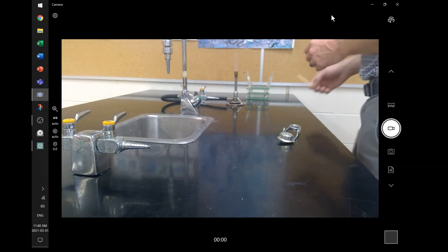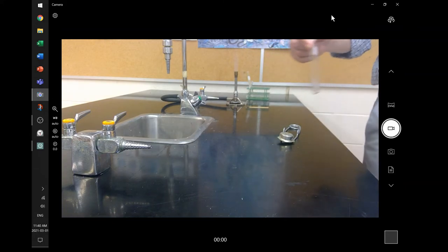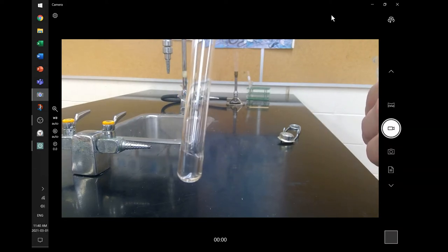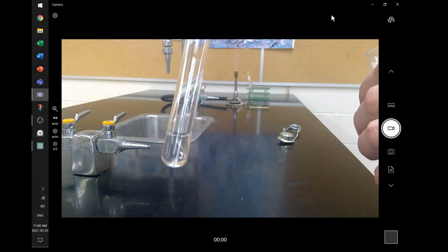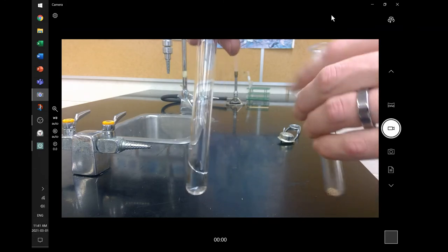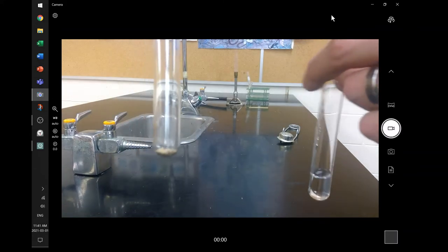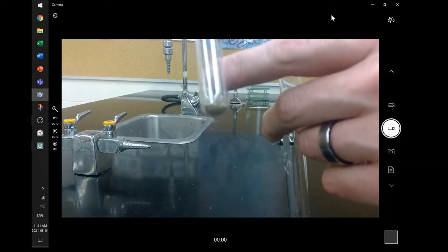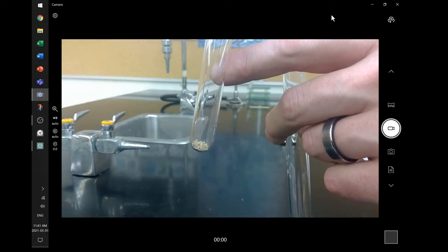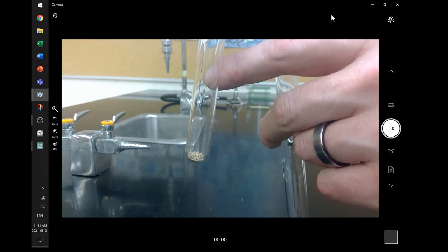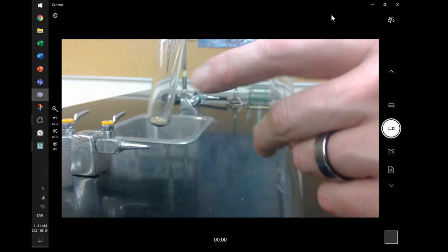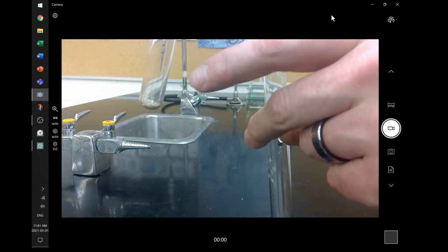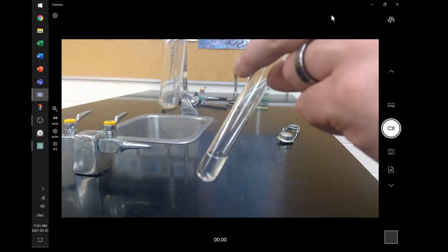So now we're going to run the second experiment. We need to produce a new set of gases. Let's test those gases. So to do that, we've got two things here. One is, again, another transparent liquid. Really hard to tell what that is. There are not really good physical properties that help me identify that substance unless I poured it out of a container and labeled the container to keep track of what it is. So this is actually hydrogen peroxide, the liquid there. Now this is yeast, brewer's yeast. You put it into like breads and pizza dough and stuff like that. It's a fungus yeast. Yeast are really important. They're probably one of the most important organisms we have as a lab organism when we study genetics and things like that. But what that's going to do is it's going to help react with this. We used to use apparently something called manganese dioxide, and they don't let us use that anymore in the workplace here at school. So we use the yeast instead.